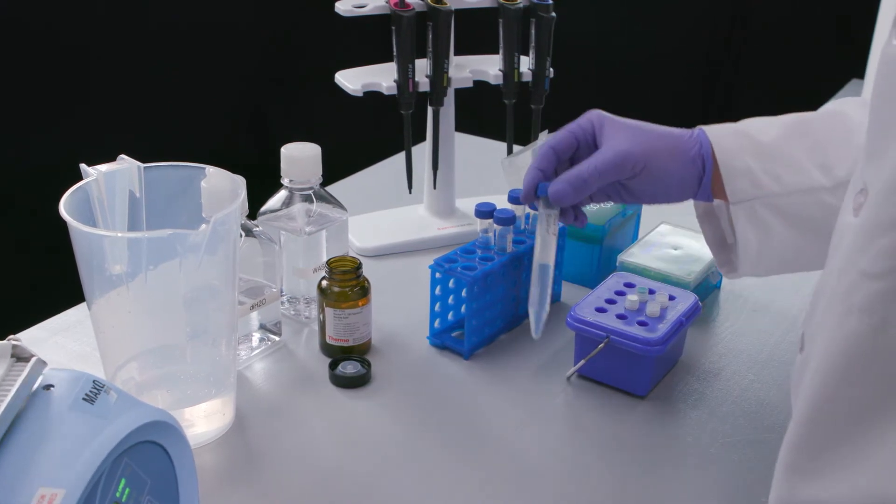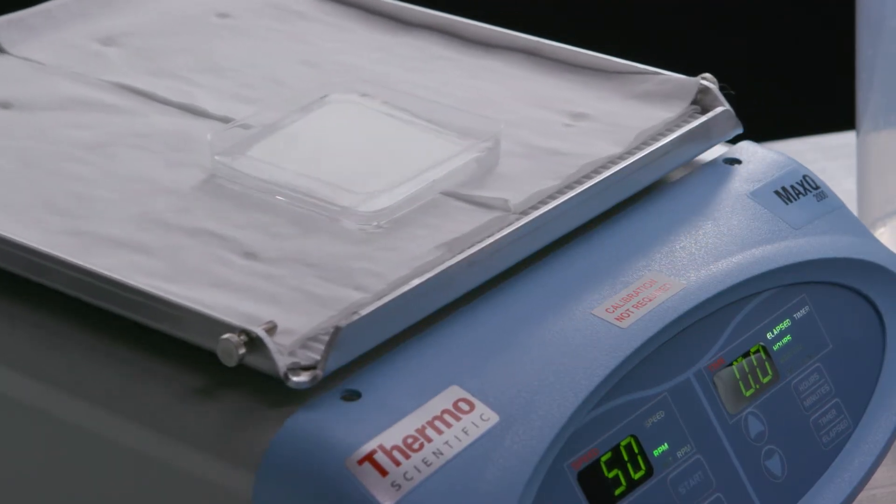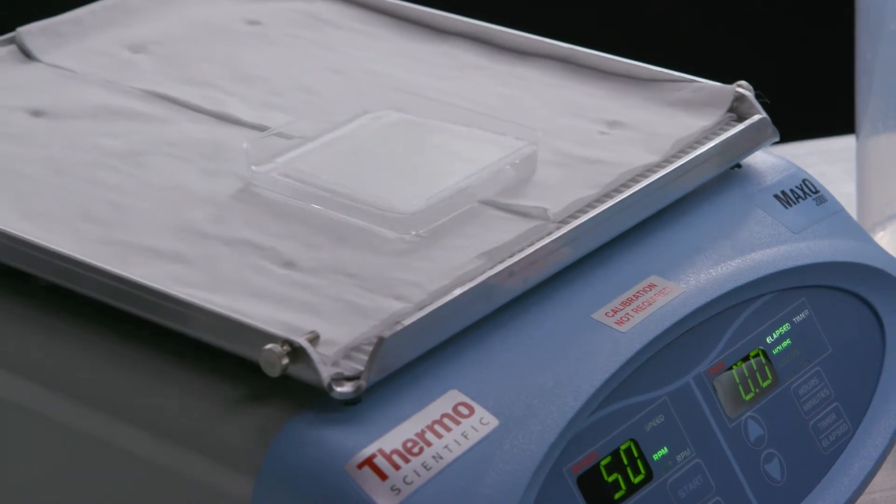Incubate the membrane with a sufficient volume of blocking buffer for 30 to 60 minutes at room temperature with agitation.